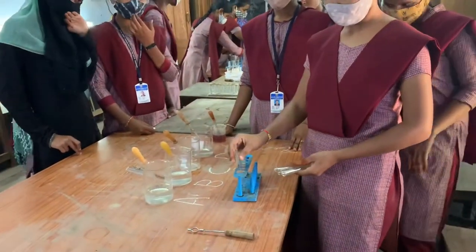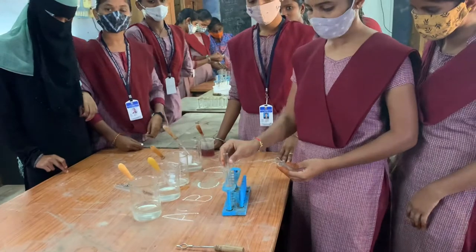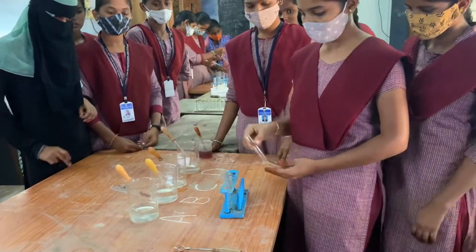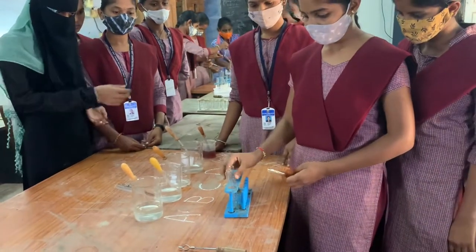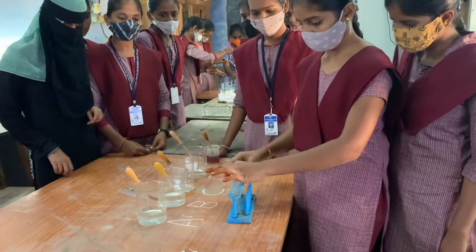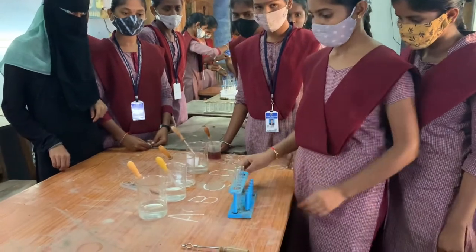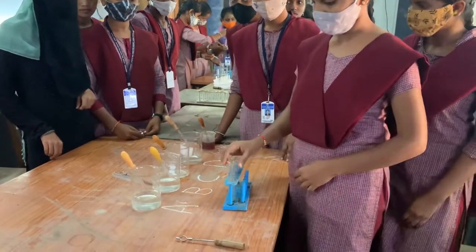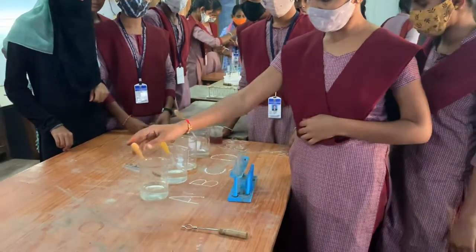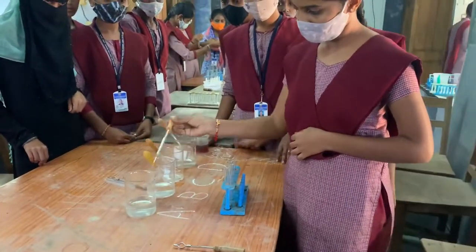First, we have to take four test tubes: A, B, C, and D. We have to label A, B, C, and D on each test tube. Then we have to take sample A in test tube A.